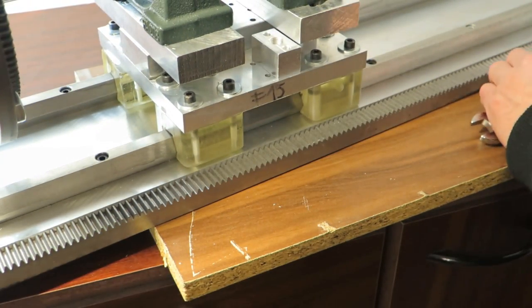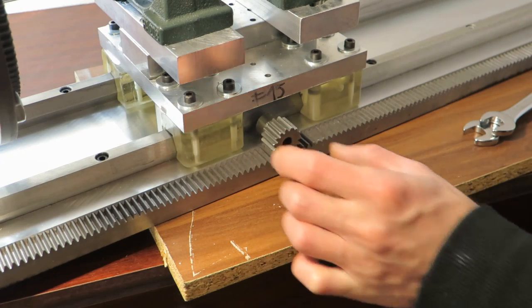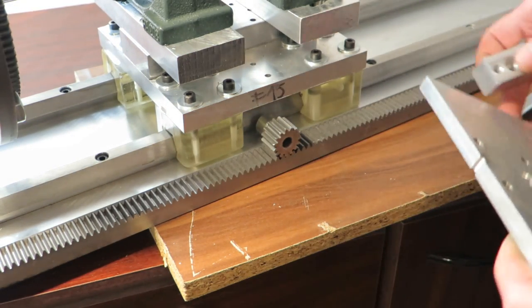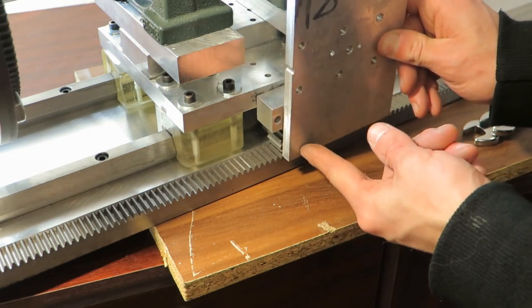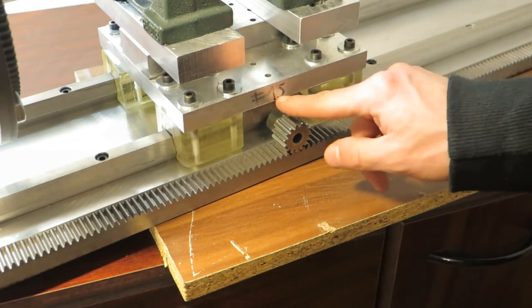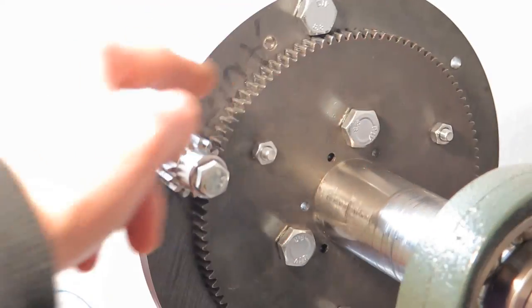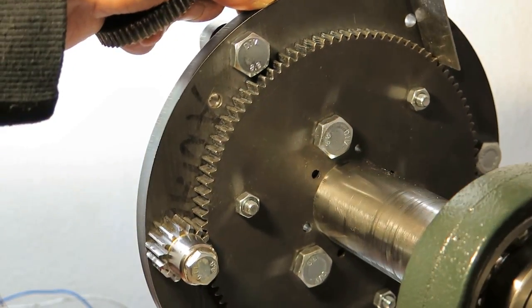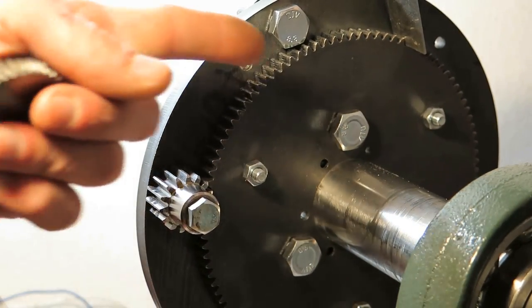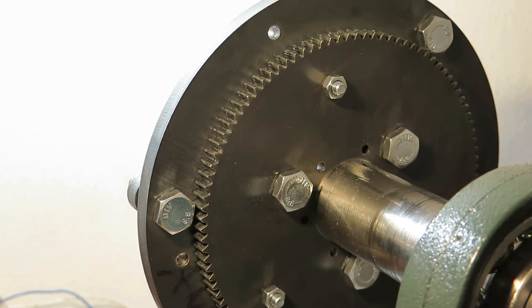And I am thinking that what I will do is drill holes from this side, and I will have a pinion there, so I can get some aluminium scrap and basically make this thing, and I will hold the pinion on this plate, and therefore I will be able to move it. Also, you can see that I have decided to use a teeth profile there. First, I was thinking about some ratcheting mechanism that will go like this basically, and you will tighten it and it will retain its position, and then some lever to pull this thing off. But that would require fairly fine tooth size basically.